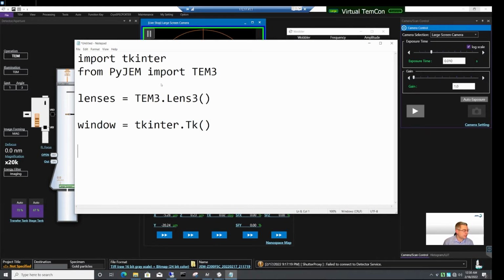Let's make it a class. So let's define a class, and let's call it StoredValue. And then this class needs a constructor. So it's a special function that is always invoked when an object, an instance of this class, is being constructed. 1, 2, 3, 4. So I'm using 4 spaces here to indicate where the indentation starts.